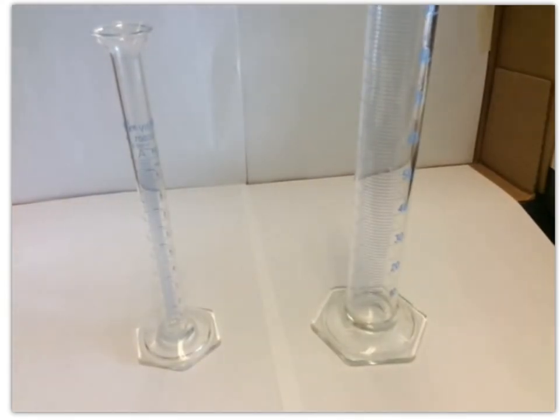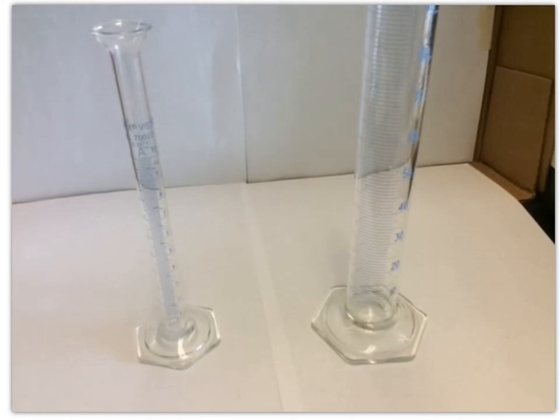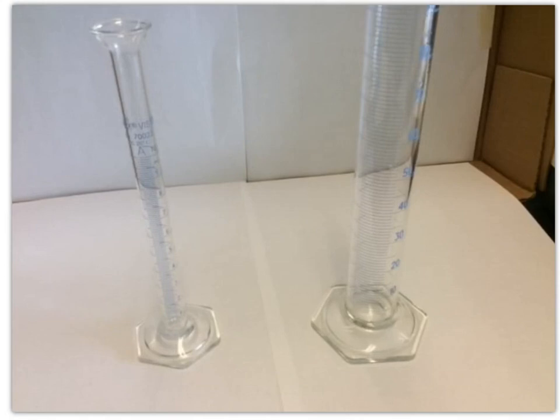So those are the tools we're going to be using a lot in this class, and so you need to know how to utilize those properly. Make sure your 10 mL graduated cylinder, you're writing down 2 decimal places. Your 100 mL graduated cylinder measurements should be to 1 decimal place, and all of our masses will be to 2 decimal places because we will use this balance or a similar one.